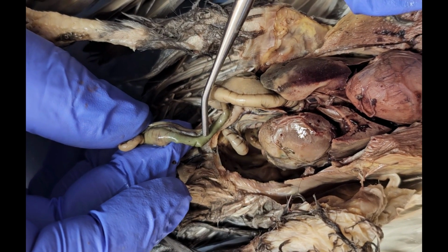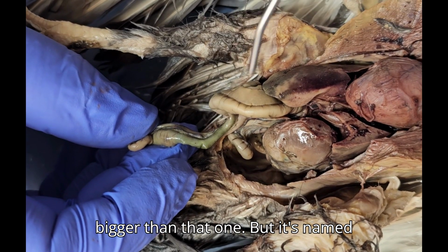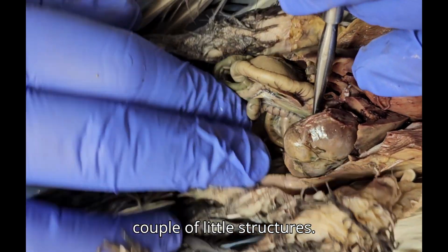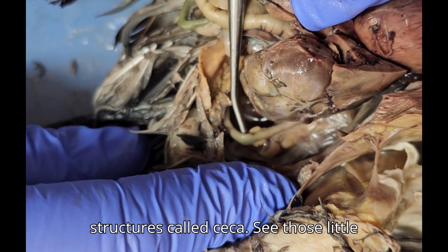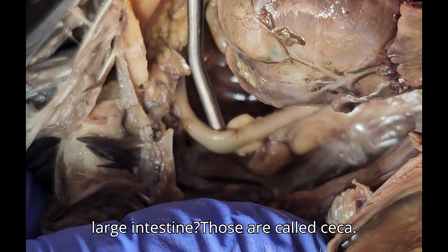Now, it's named opposite, right? Because this should be bigger than that one, but it's named based on the human counterparts. At the very end of the large intestine, we see a couple of little structures. There we go. A couple of little structures called ceca. See those little ear things sticking off the side of the large intestine? Those are called ceca.